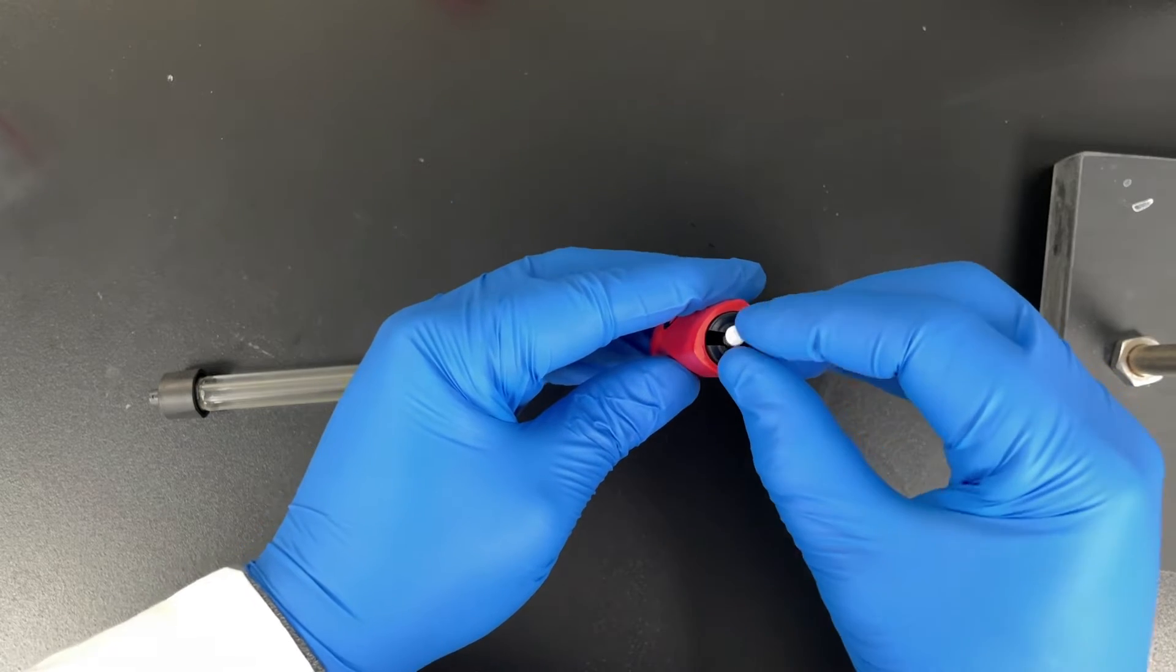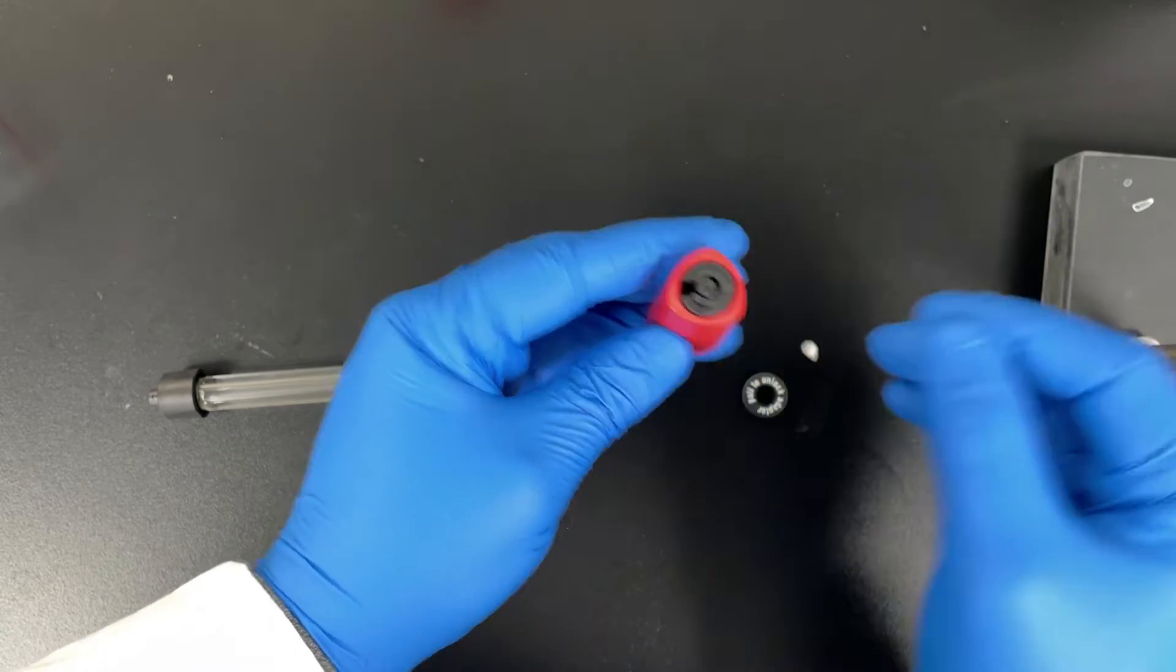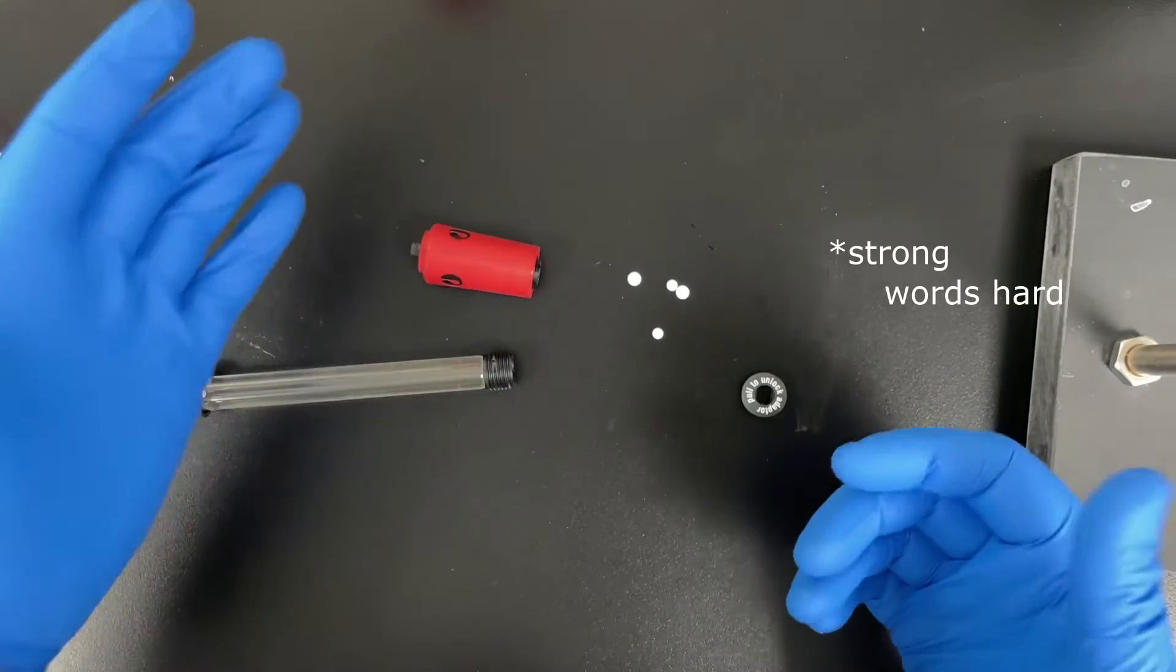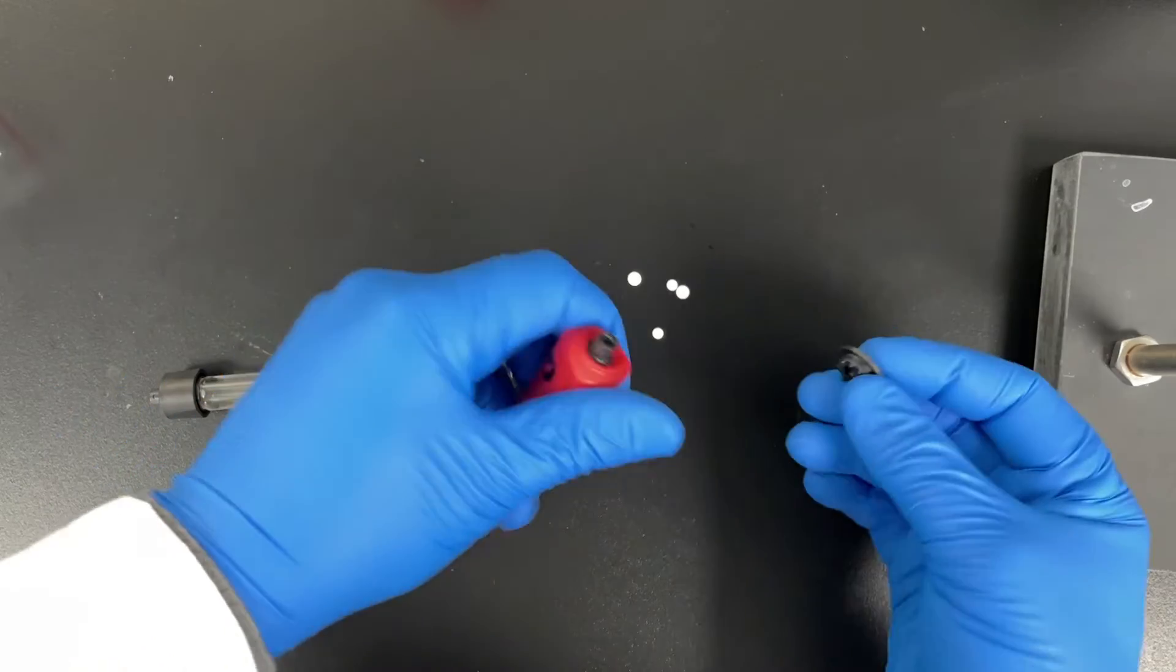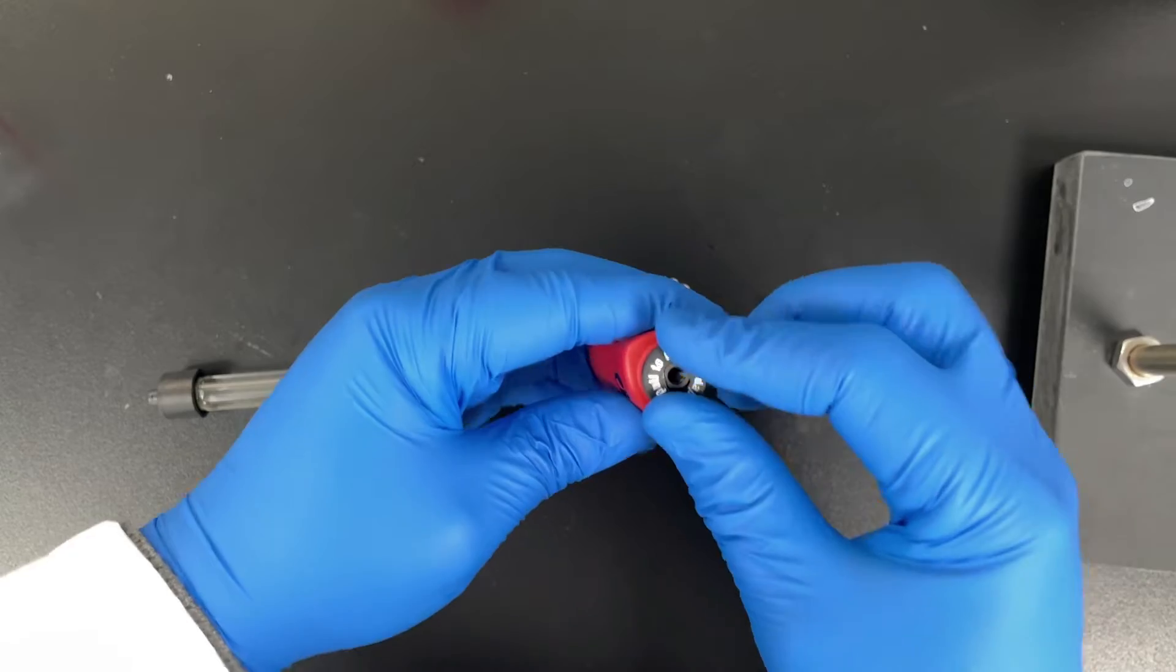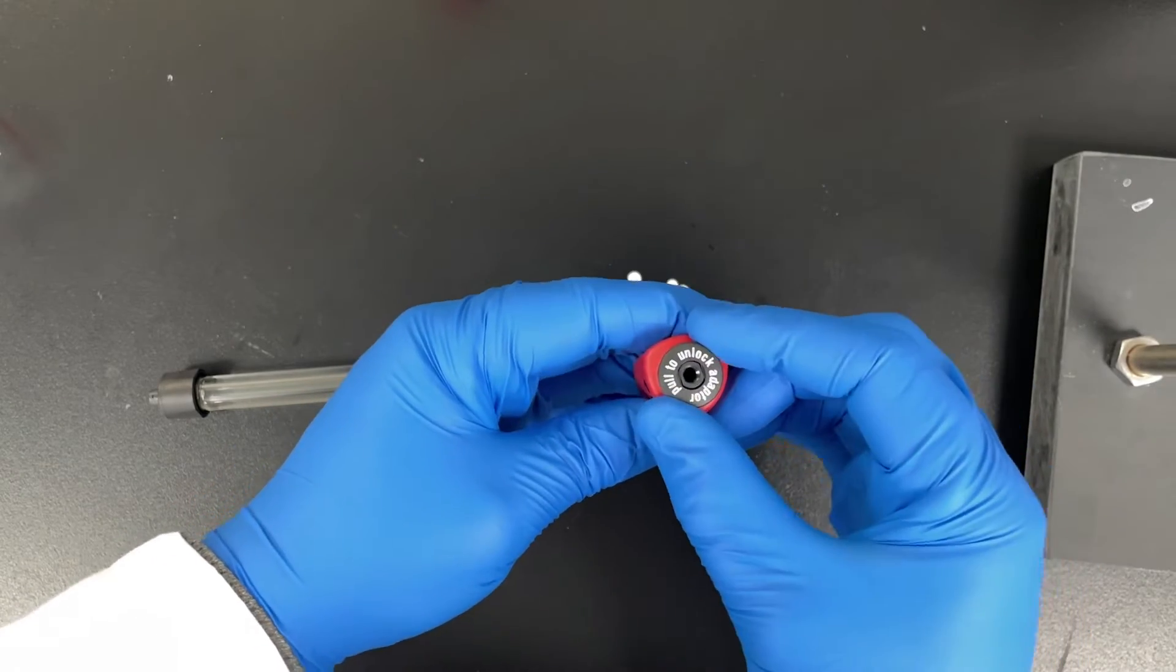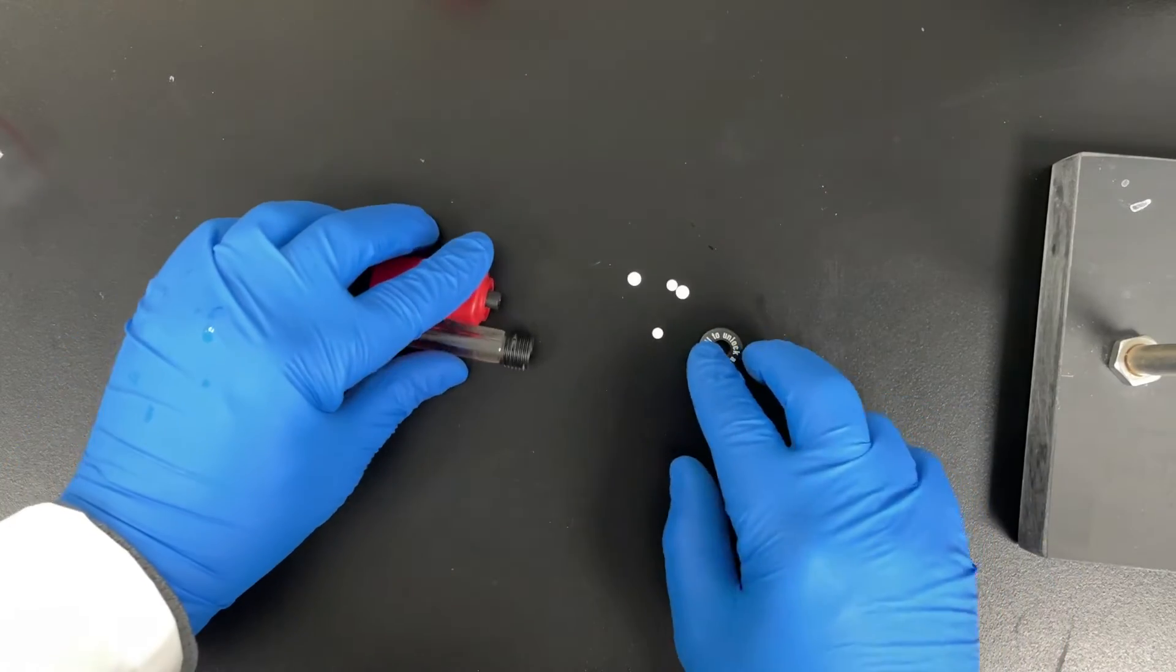Now that's where the filter is supposed to fit, but static electricity makes the filter want to stick onto my gloves. This is the locking mechanism and it fits into place. That keeps you from actually turning the top adapter once you finish packing it.